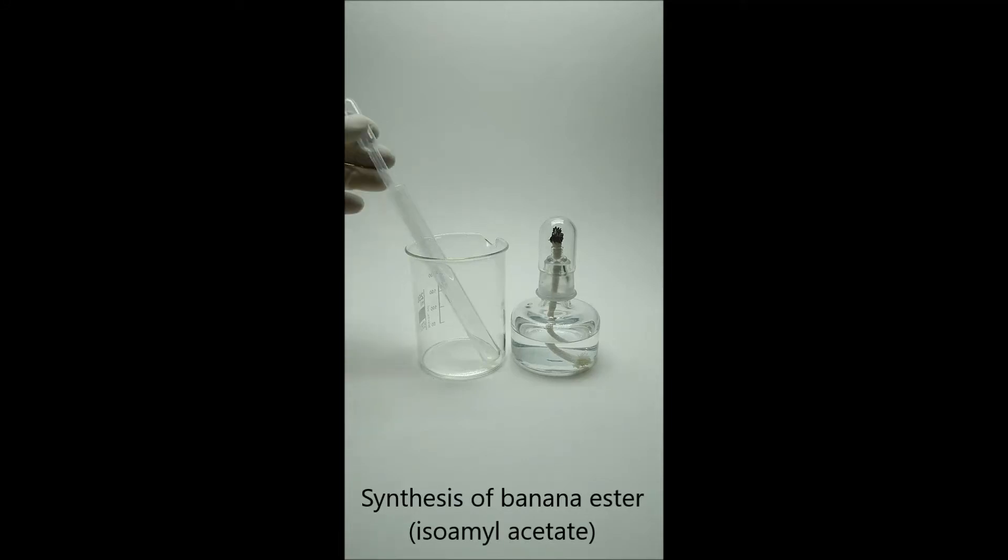Hi, I will do a synthesis of banana ester, also known as isoamyl acetate.